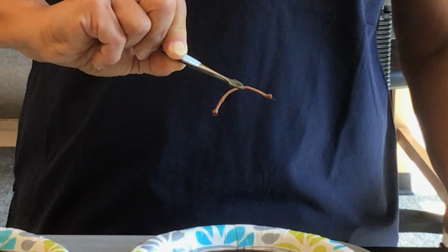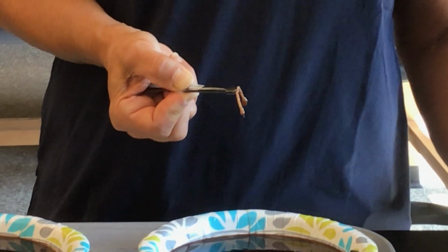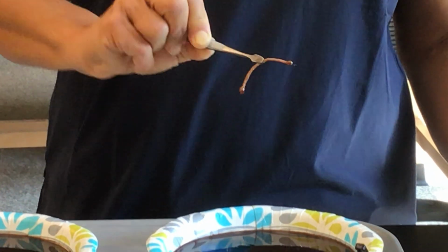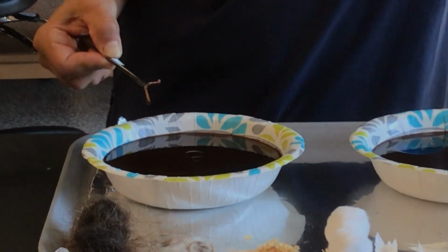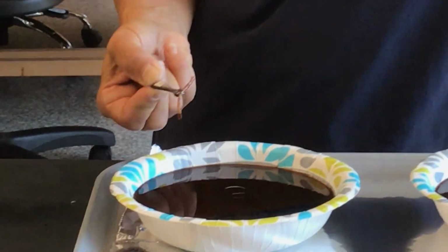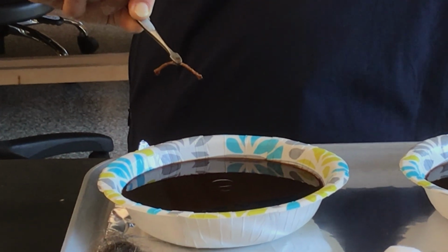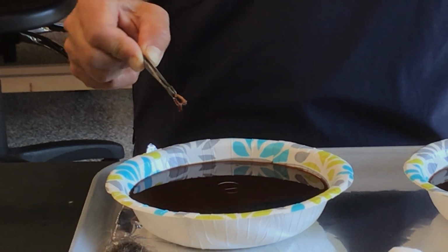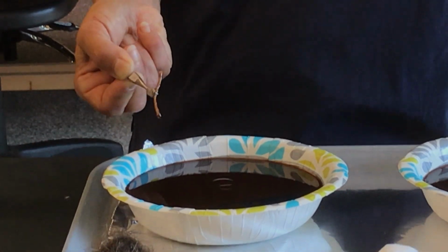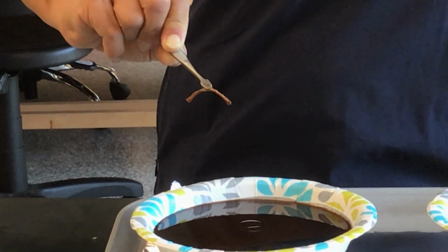So, you know, make your observations and describe how well you think it absorbed the oil versus the water. Okay, that's in our salt solution. And then in our freshwater solution, well, it looks a little bit different. Okay, so again, make your observations and write it down in your handout, or type it in your handout, I should say. Everybody should be typing their labs up to submit online. Okay, so a little bit different in its appearance in the freshwater.